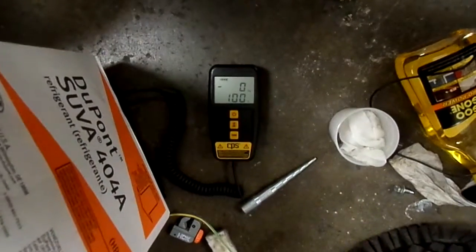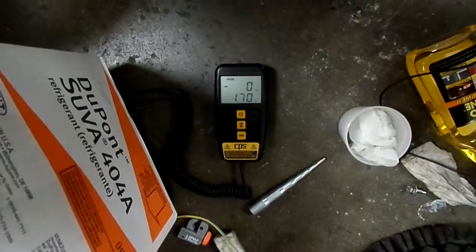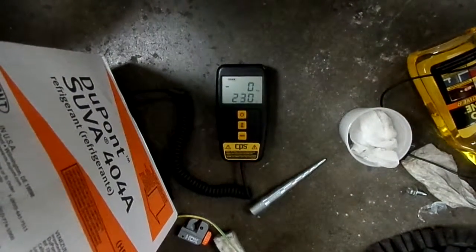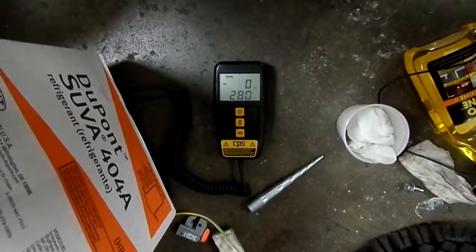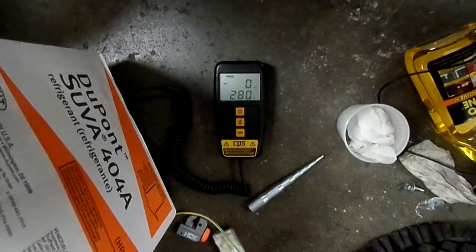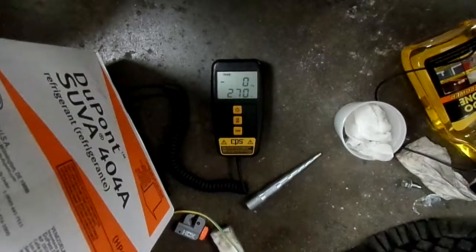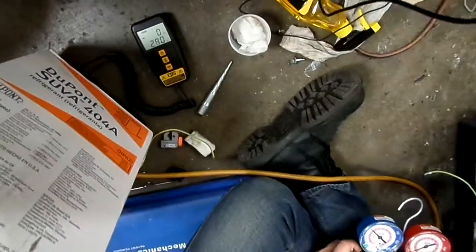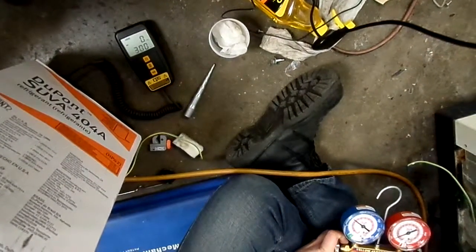Just watch your scale. Stop it before it gets to 300, and then open and close your valve to be sure you're putting in the exact amount. You don't want to undercharge, you don't want to overcharge. So like right now, I'm going to go ahead and turn it off. I'll let it settle. It seems pretty solid. See, yeah, there it goes back and forth. So I'm just kind of quick open and close. Quick open and close. Quick open and close. Until we get to a solid 300.